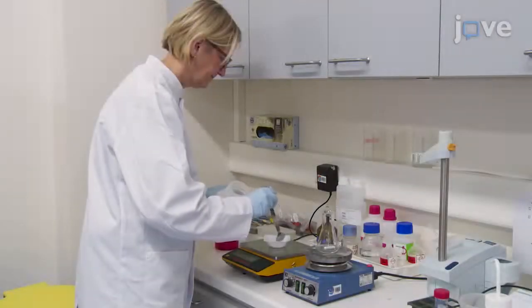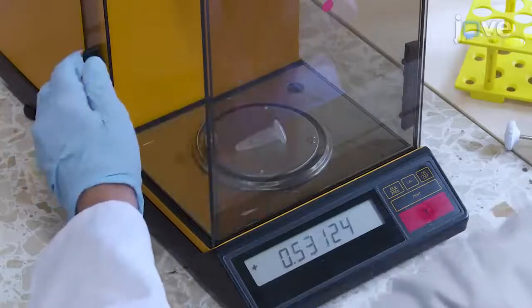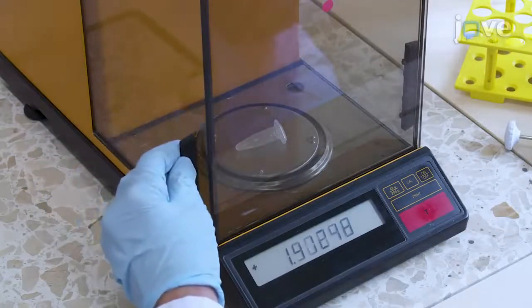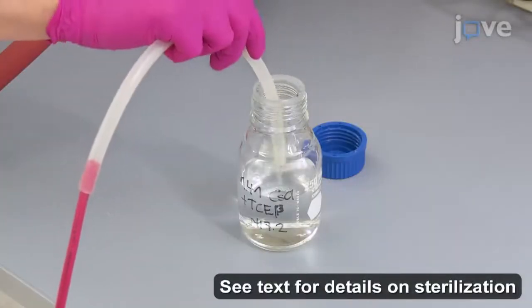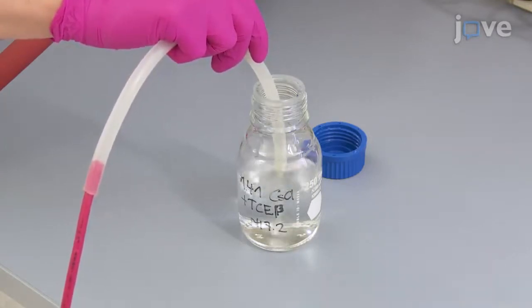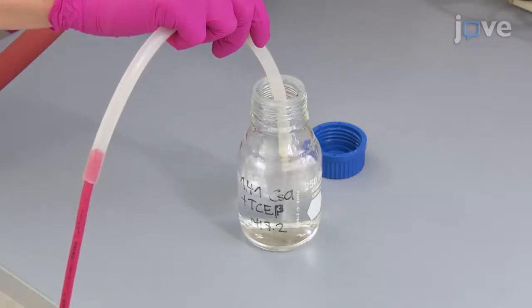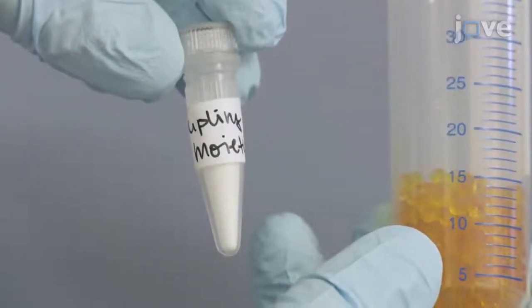To begin this procedure, prepare all buffers as outlined in the text protocol. Weigh 1 milliliter of each gradient buffer to check its density. After sterilizing all of the buffers, sparge the buffers containing TCEP with argon gas for about 30 seconds to prevent oxidation of the TCEP. Store the vials containing the solid powdered coupling moiety in larger tubes.